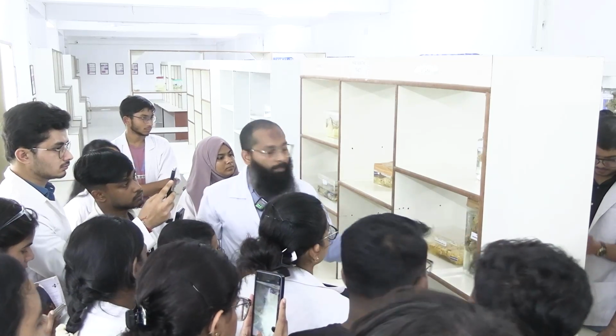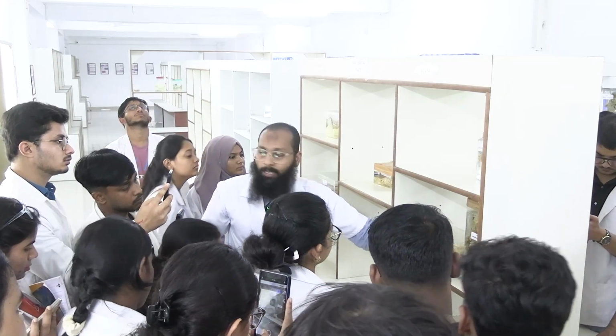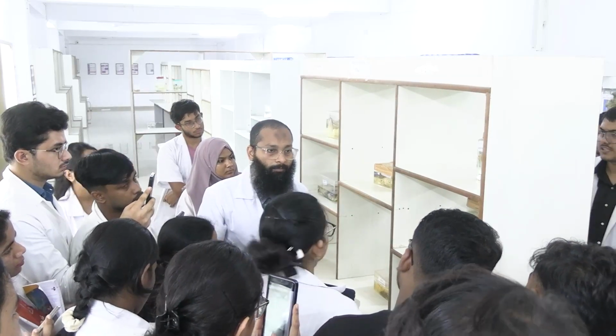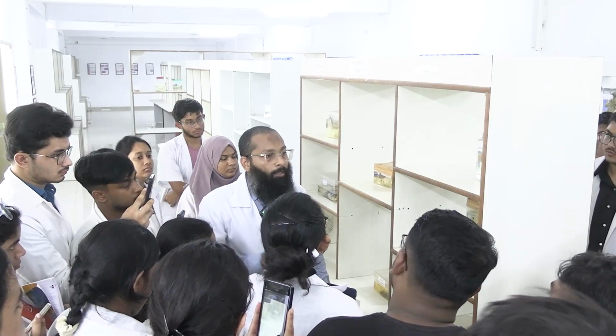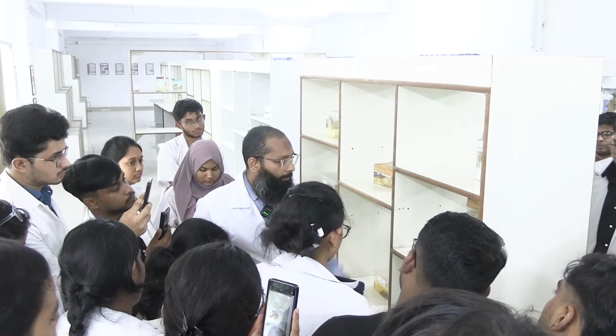Can anyone please tell me why this whitish appearance is not normal? If somebody says that no, this could be a part of a breast. No, not calcification. What is the normal component present in the breast? Yes, it is mainly the adipose tissue that is found in the breast.